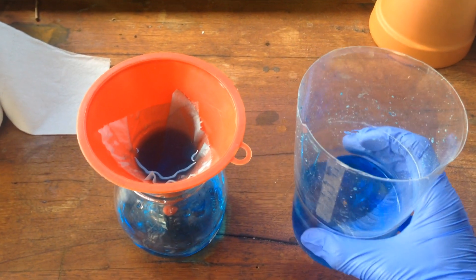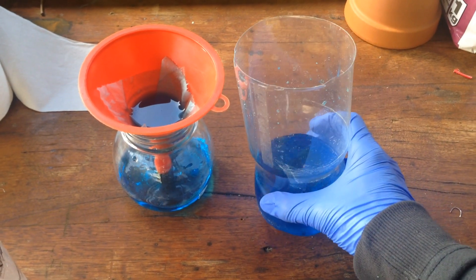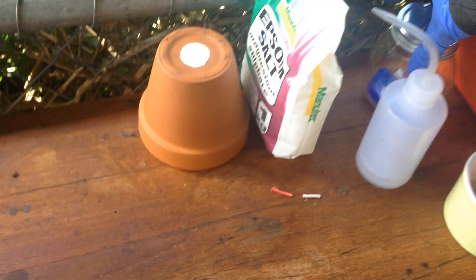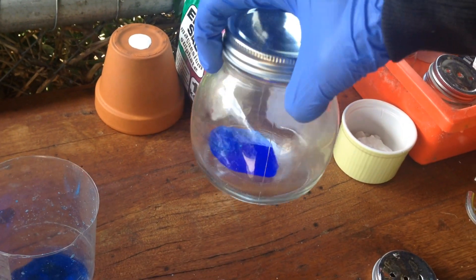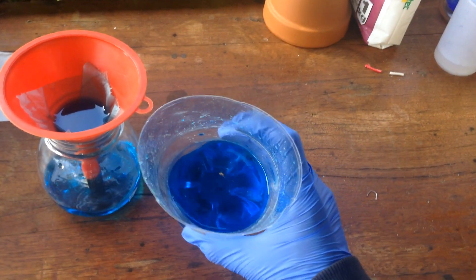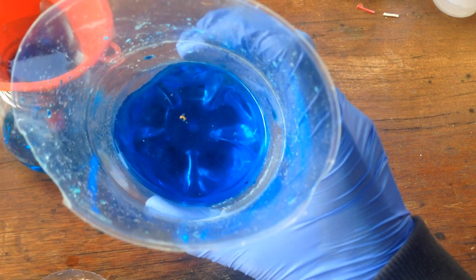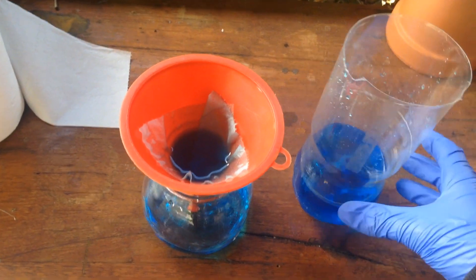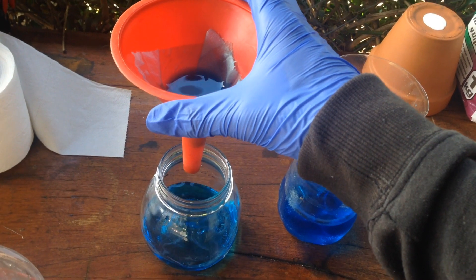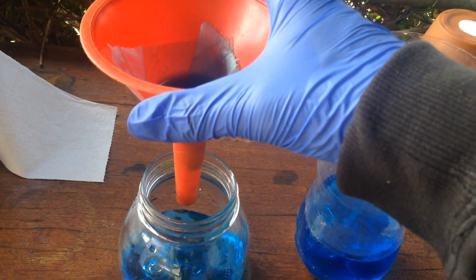For the last while I've been trying to gravity filter this copper sulphate solution that I'm slowly evaporating down, just to get some copper sulphate powder back from when I dissolved some for the copper sulphate crystal I made in a previous video. In that time there's been a few bugs falling into it, and in the bottom there's a little bit of dust, so I've been filtering it off. But this gravity filtering is taking a very long time — it's hardly even dripping at all. There's a drip.